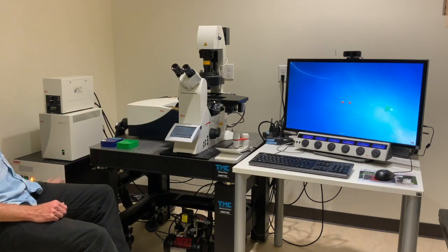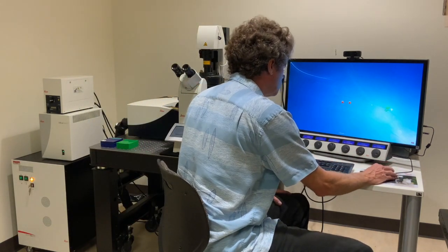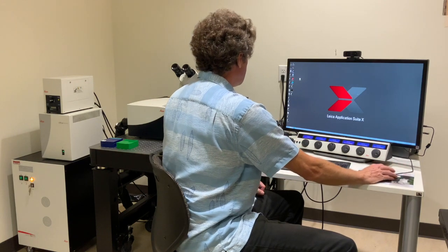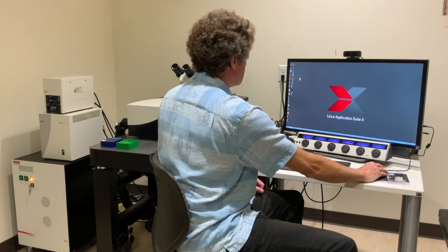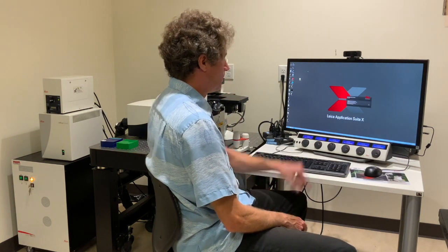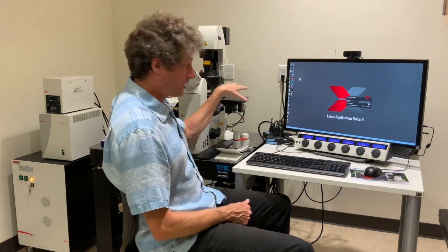This is the fluorescence bulb and I'm not going to use it today. The computer's up. You're going to log in to TCS user — this will come up, no login. Then you're going to find LASX, Leica Application Suite X, which is up here. You'll start LASX and it will start going through its cycle. There's going to be one very important question — it's going to ask you about the stage. The stage is motorized.